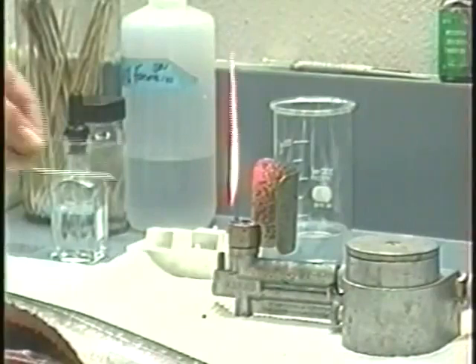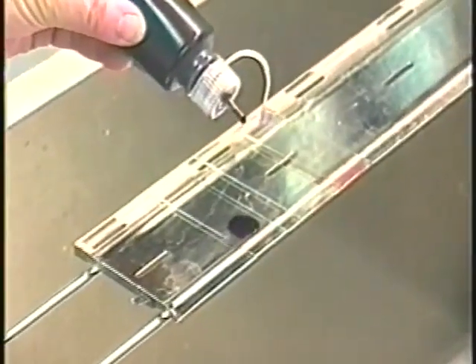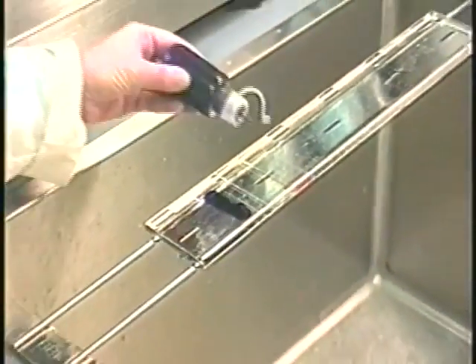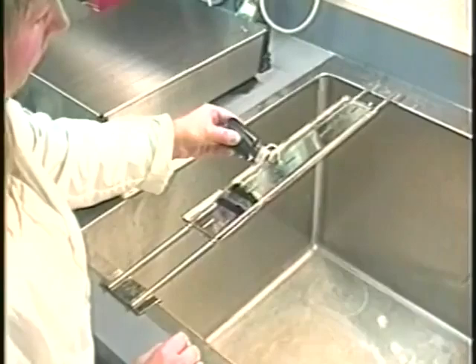Using a flamed inoculating loop, go back into the kidney tissue and smear a thin layer of material onto a clean microscope slide. If the smear is thick, a drop of water may be added to spread the cells into a single layer. This tissue is allowed to air dry and then passed quickly over a flame to fix the cells to the slide. The procedures for staining and examining these smears will be discussed later in the discussion on bacteriology.